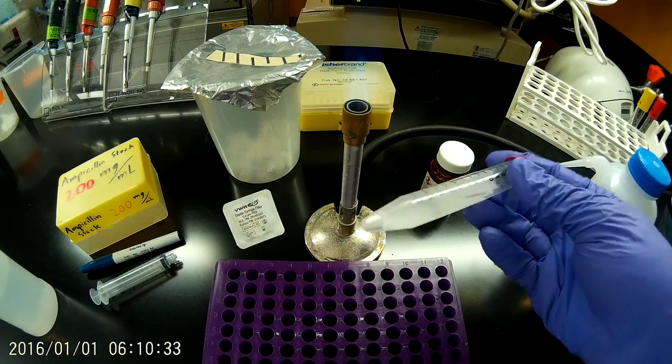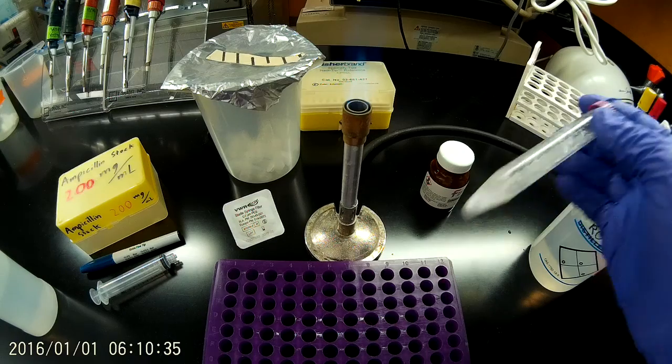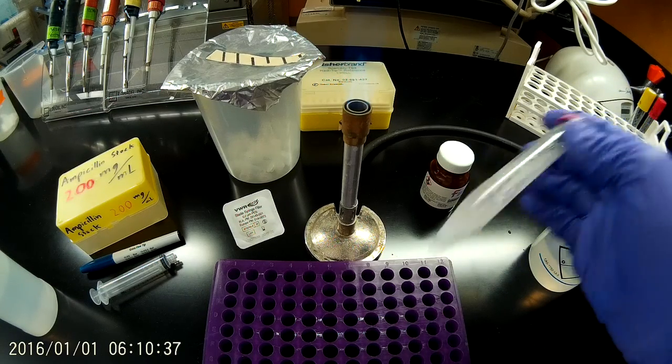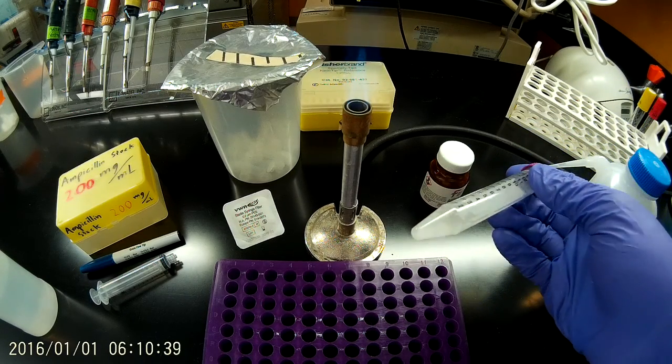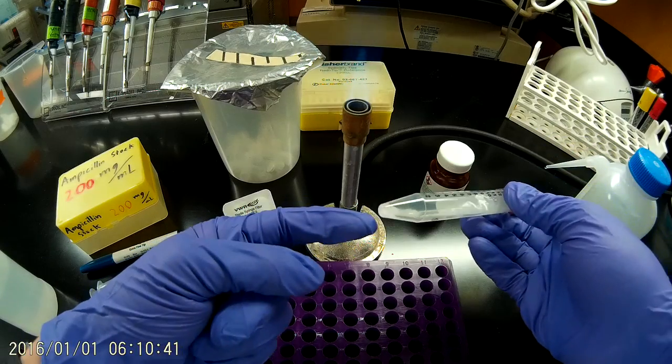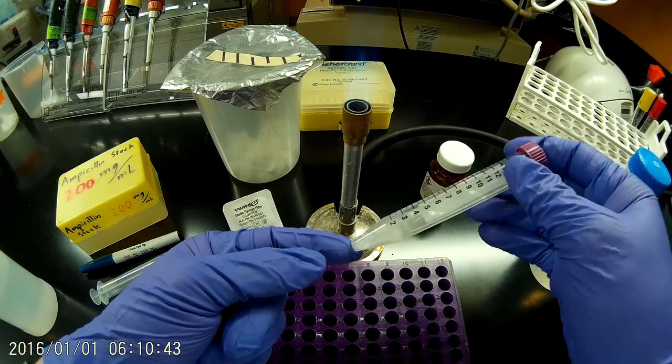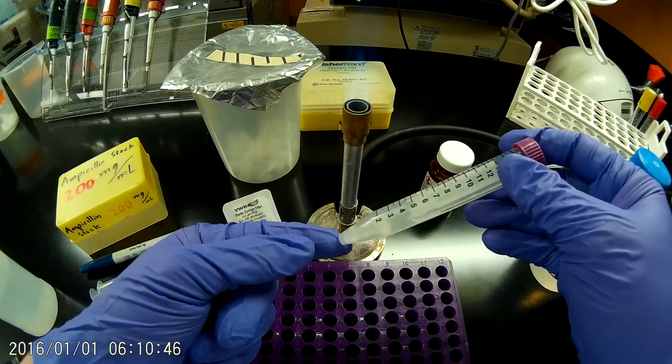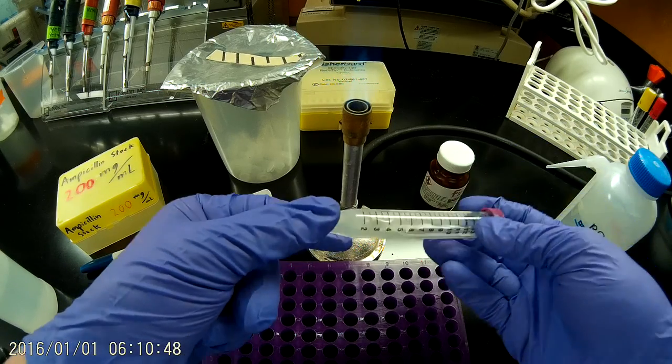I'm going to rock that back and forth. It's worth noting that I've actually weighed out my ampicillin directly into the tube where I'm going to measure out the volume. That's because ampicillin actually gets kind of sticky. If you weigh this out into a weigh boat and then try to rinse it into your tube, you might end up with some transfer losses.